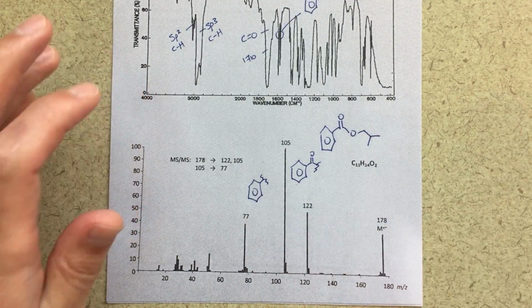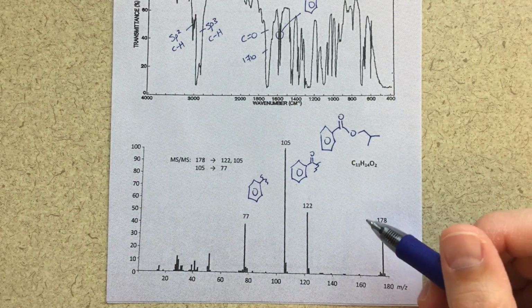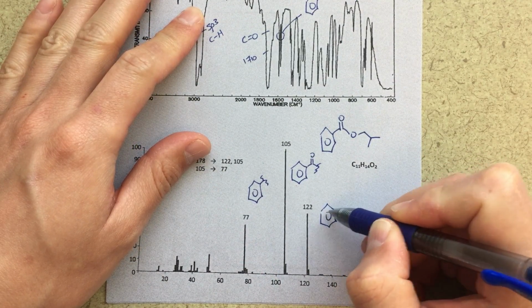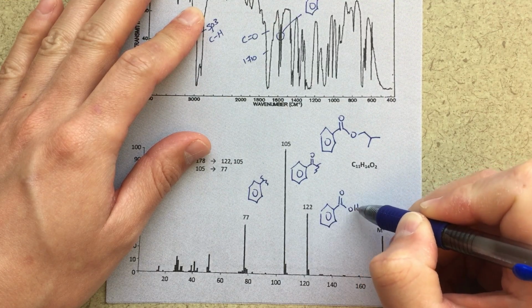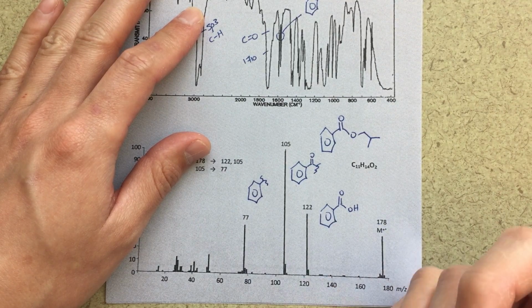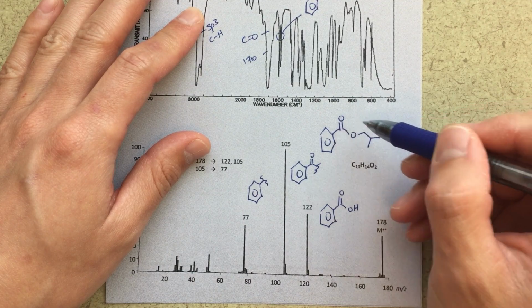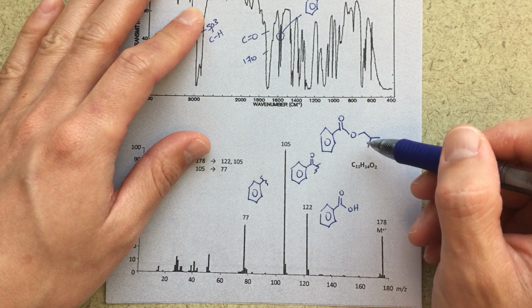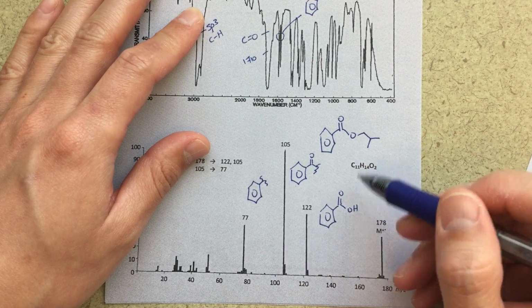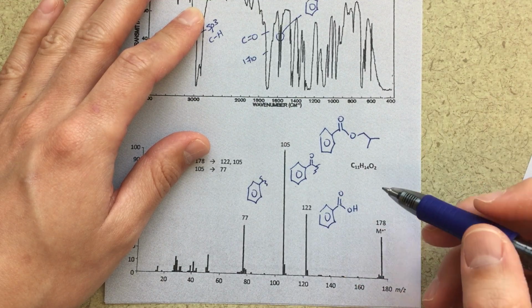Now this 122 peak took me a little bit of time, and I actually had to consult Roxy, my fellow organic chemist, to help me out with this. When I drew it out, I was like, well, this is the fragment that we're seeing at 122, but how do we get that fragment? There's actually a rearrangement that can occur where this oxygen gets protonated from this hydrogen here. So this swings around. We can protonate, and then we can cleave. So it is the same fragment, it's just flipped. But this is a rearrangement and then a cleave to get to this fragment.